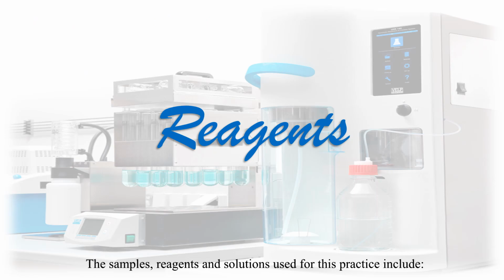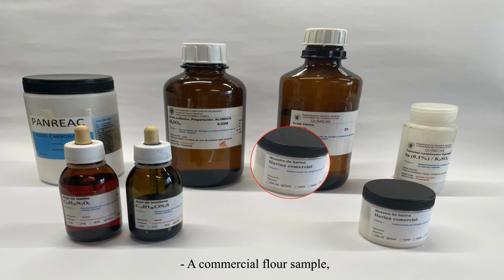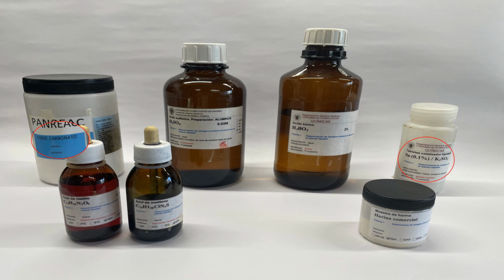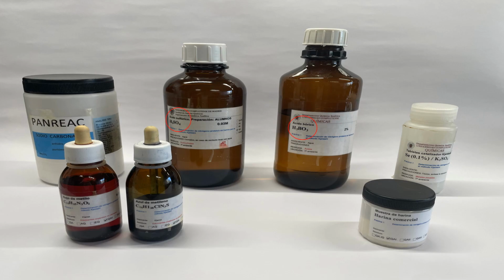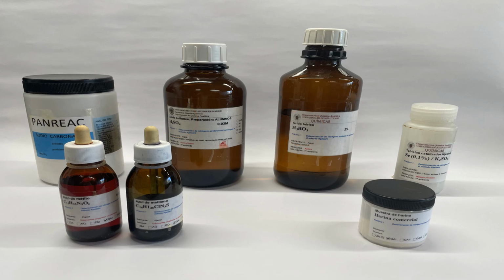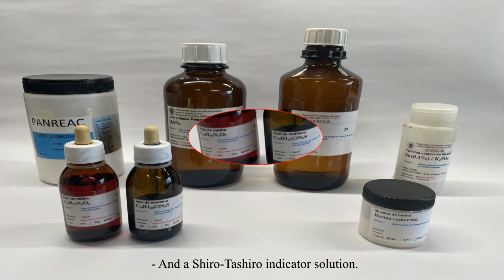The samples, reagents, and solutions used for this practice include a commercial flour sample, Kjeldahl catalyst tablets and sodium carbonate, a 2% boric acid solution, and a 0.03 molar sulfuric acid standard solution, and a Tashiro indicator solution.